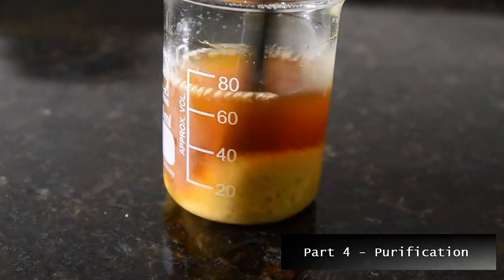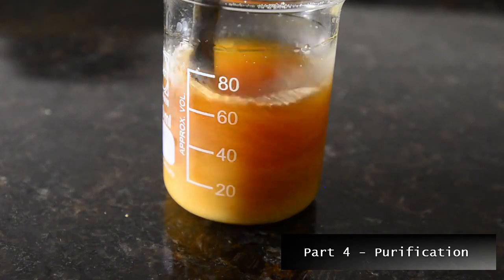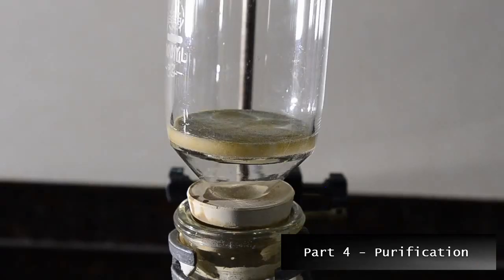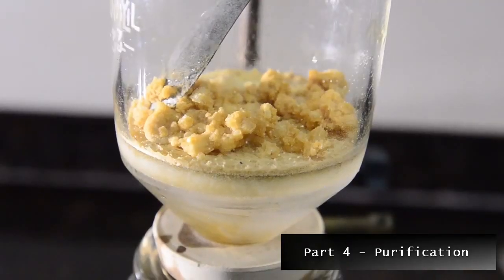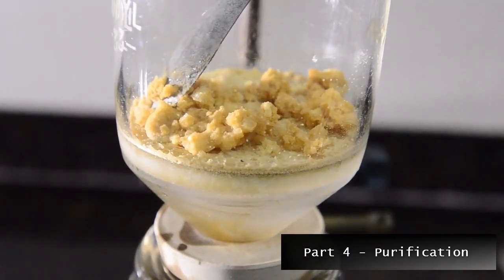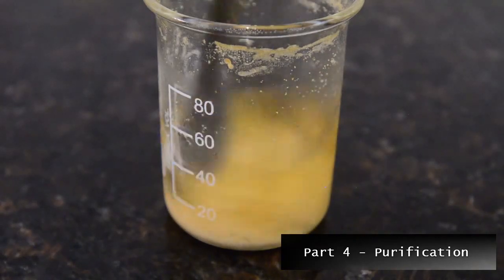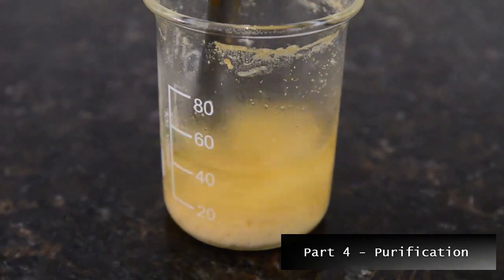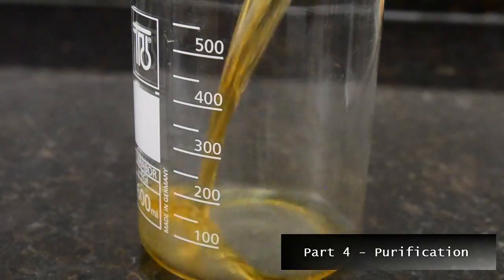Stir the mixture well to get as much solid dissolved as possible. Then filter off the ether containing our product. The solid remaining should be washed with a further 40 milliliters of ether and this filtered through again. Combine the ether portions and evaporate to dryness.